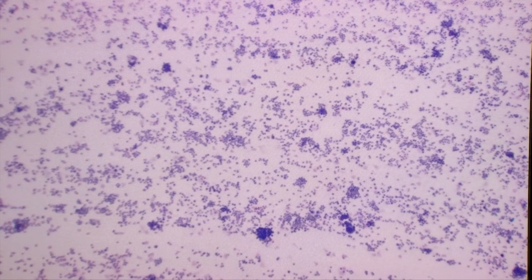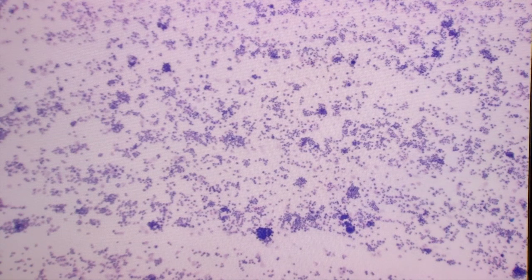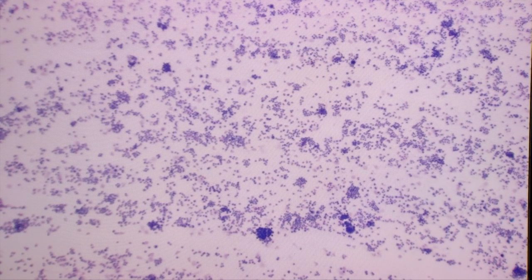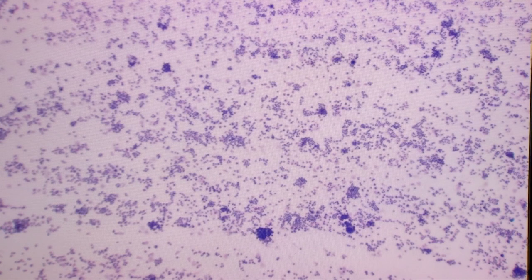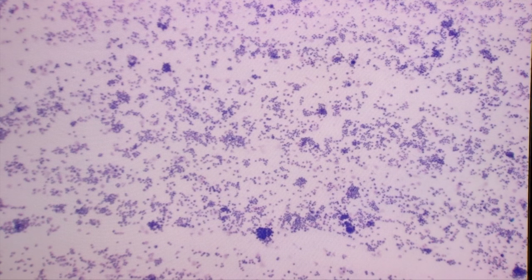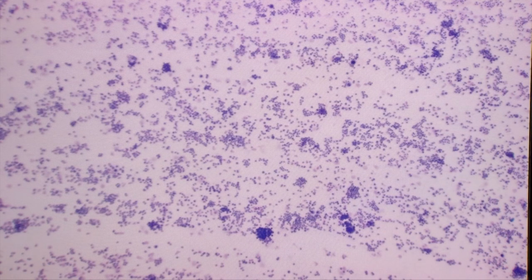Today I have a direct smear from a dog that has been stained with Wright-Giemsa, and this smear is from thoracic fluid from this dog. I want to show you the basic technique for evaluating a cytological smear.